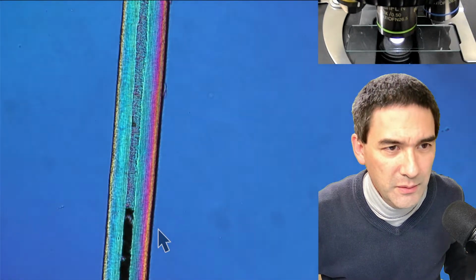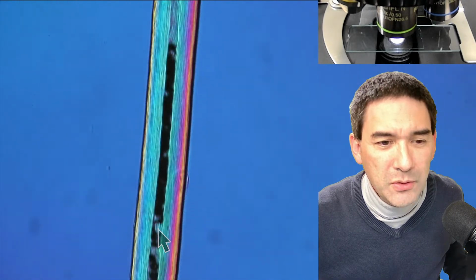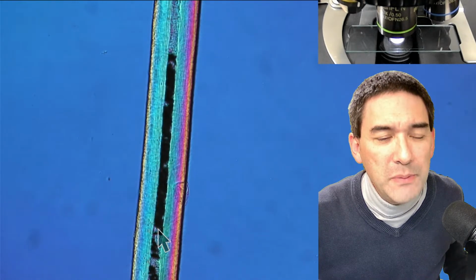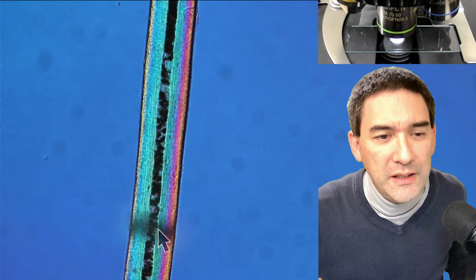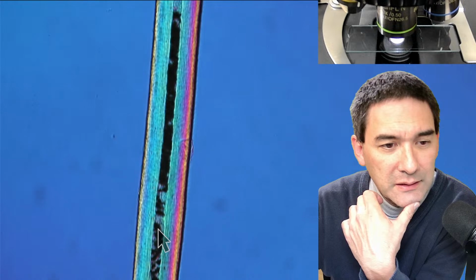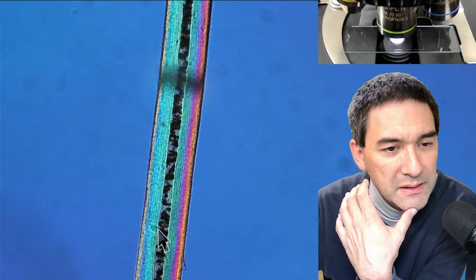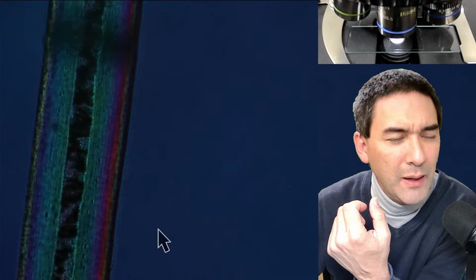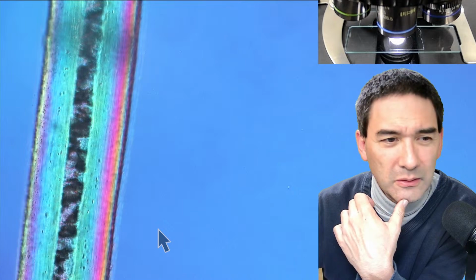So what in the world's going on here? There seems to be, I don't know if it's just the pigment or so. What I also heard is that sometimes the medulla, the inside, could be actually hollow. So my first idea was that maybe there's some air inside here, and this causes a huge difference in the refractive index and maybe causes it to appear black. Yeah, the inside. But it doesn't really look like air either. So there still seem to be probably some pigmented cells in here in the center. But my first impulse was to think, wow, there must be some kind of air in there, which makes it kind of dark. But this does not look like air bubbles, really.